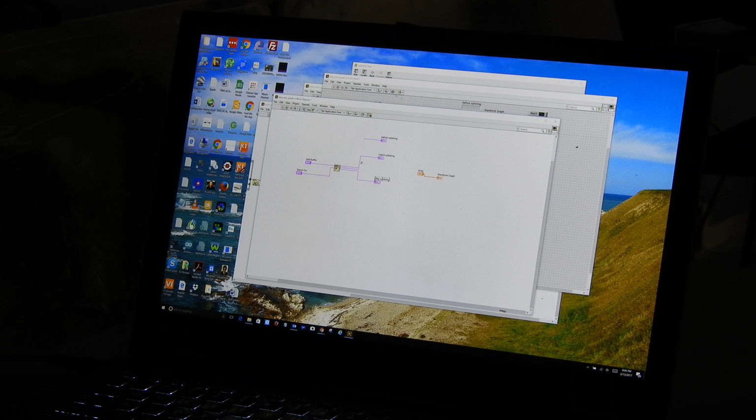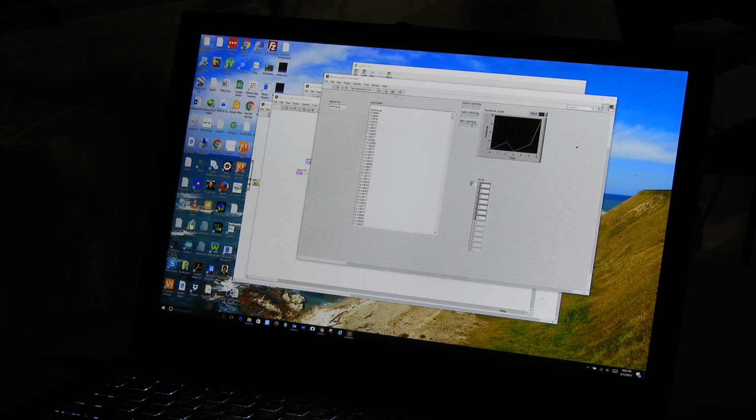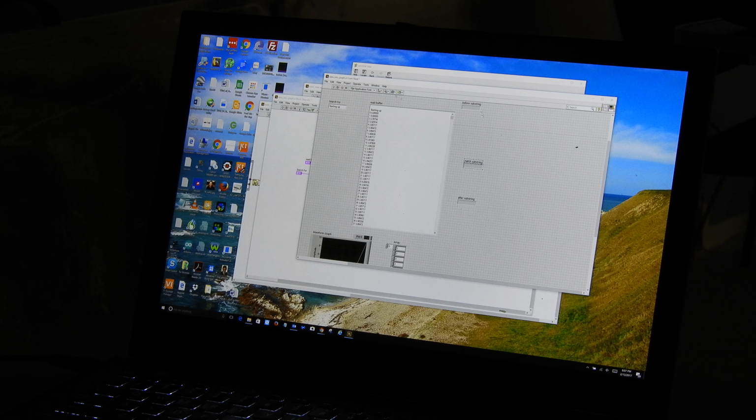So now I've taken all three of these outputs that come out of this function, and I put them as outputs right here. Let me go ahead and move this out of the way and move this out of the way so we can play with this and see what happens. When I program, I usually step through things kind of slowly, and I'm real careful and meticulous, and I like to make sure that it's going to do what I think it's going to do by testing it the whole way. Every time I do something, I test. All right, so we've got this match substring. We've got before, match, and after. And I'm going to make all three of these bigger so we can see what comes out of all of them.